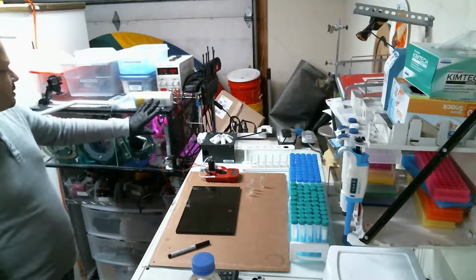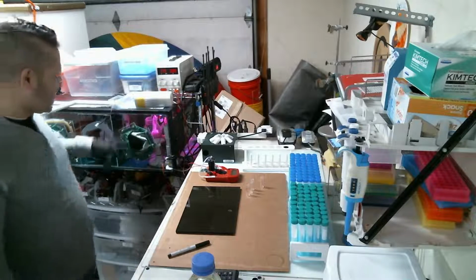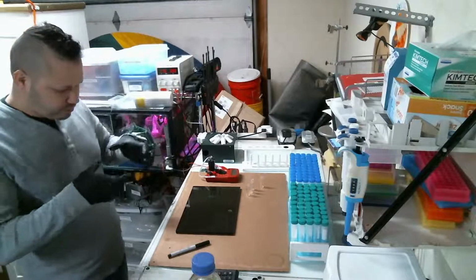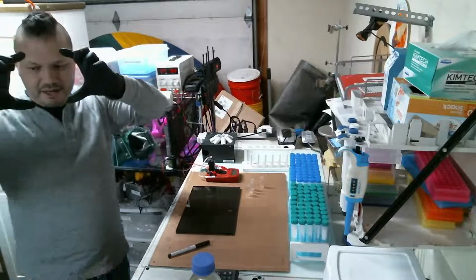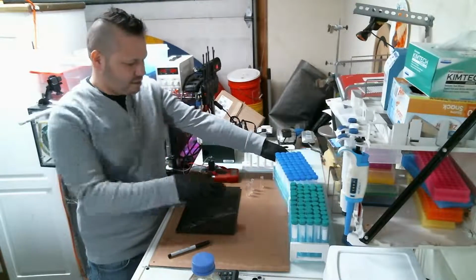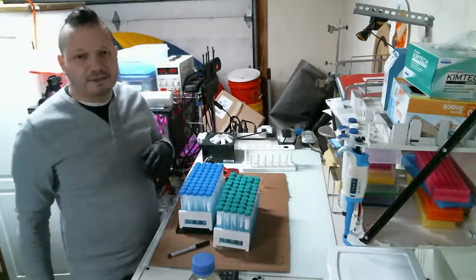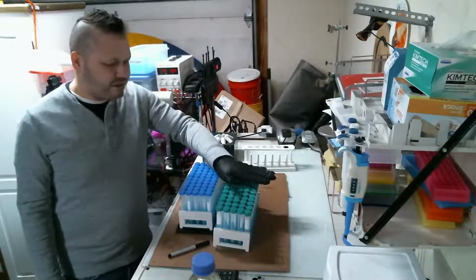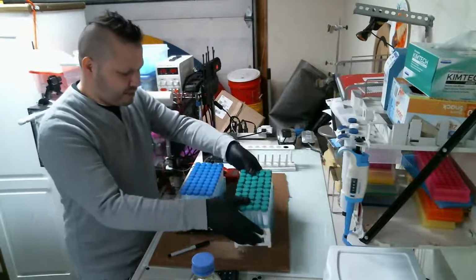I'm actually upgrading this incubator. The incubator will stay the same, the size and everything, but right now the grow light in there is maybe 10 centimeters by 10 centimeters, and there's not enough space to put these and these on there. Because there's such a time crunch, I need a large enough sample size to have enough significance to report.